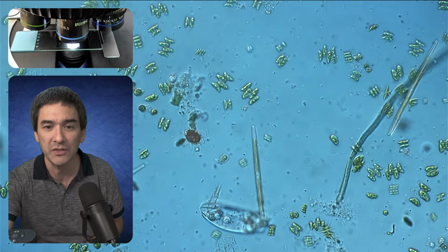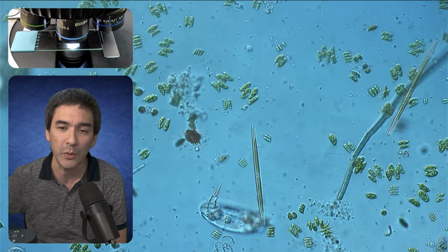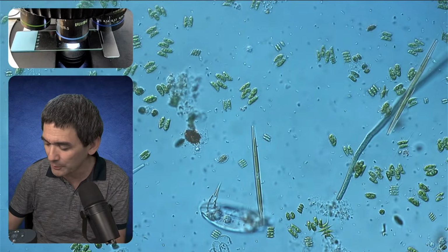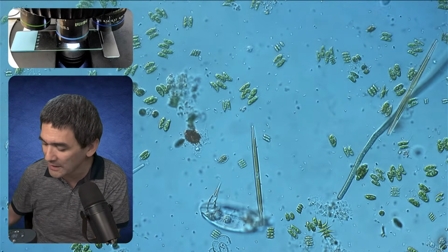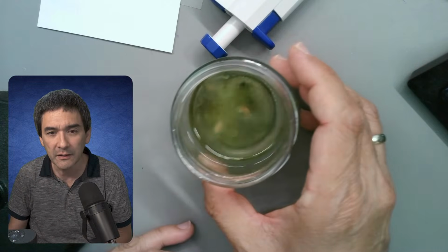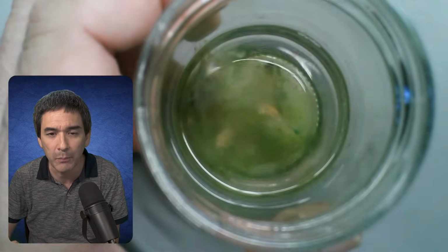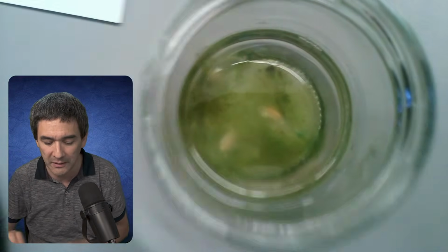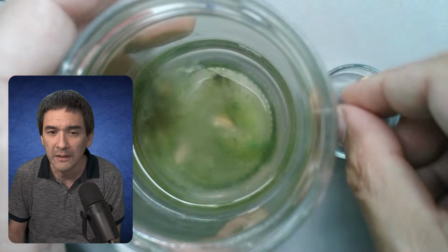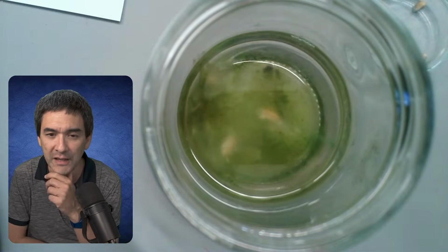The specimen that you see right now is actually a specimen that we also looked at last week. I'm going to show you quickly. This was the enrichment culture which we made 2 weeks ago. If you joined in last week, this is a pond water sample, and I dropped in a couple of wheat grains 2 or 3 weeks ago. Basically, this is how the water sample looks now.